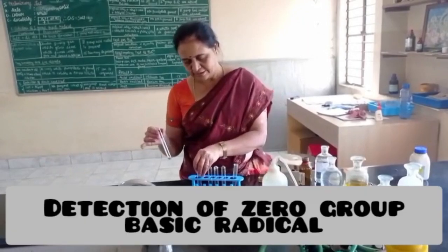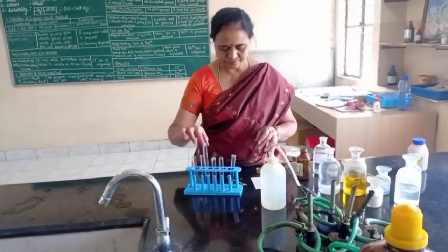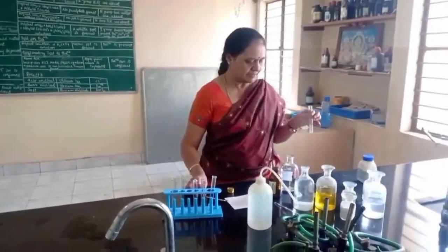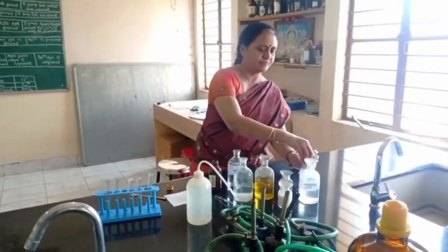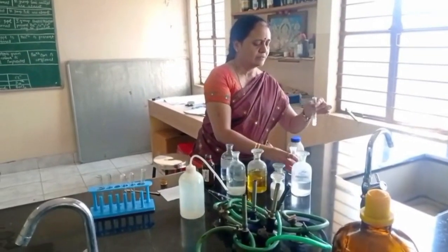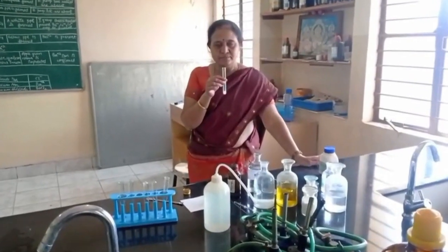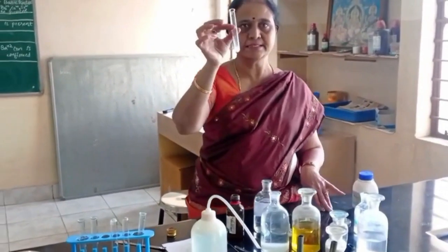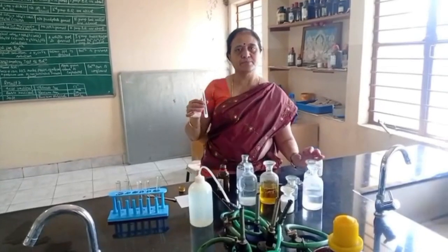Now basic radical. For zero group basic radical, I take a salt plus dilute NaOH. Salt plus dilute NaOH. See here, I am smelling the gas. No pungent smell of ammonia gas is observed. So, zero group basic radical is absent.